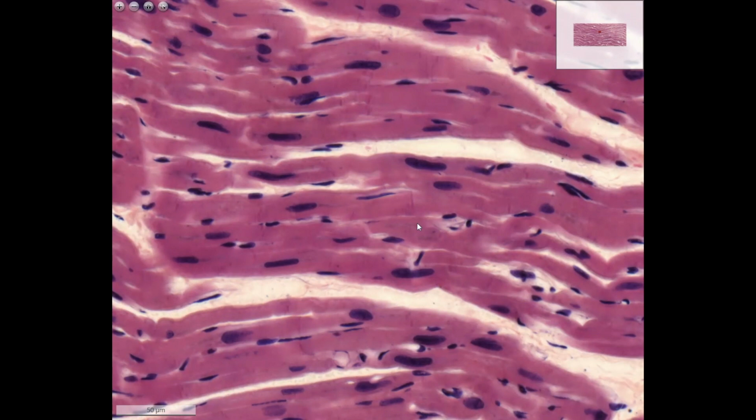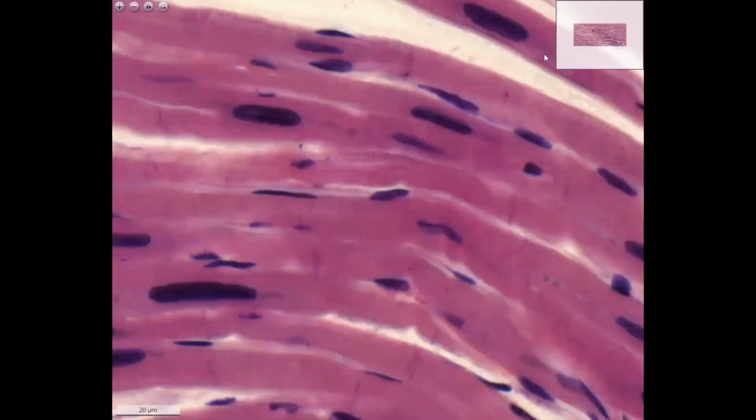With this, it makes a so-called functional syncytium, because through the gap junctions, the depolarization can proceed without any delay to the next cells. Here you see also intercalated discs in this region. Occasionally, the cross striation is also visible, like here, or here, or here. Again, if we would have the chance to adjust the light and play with the micrometer, then we could visualize it better.